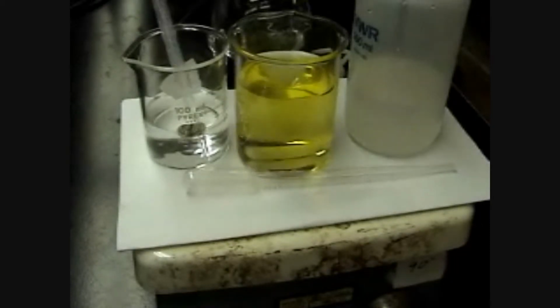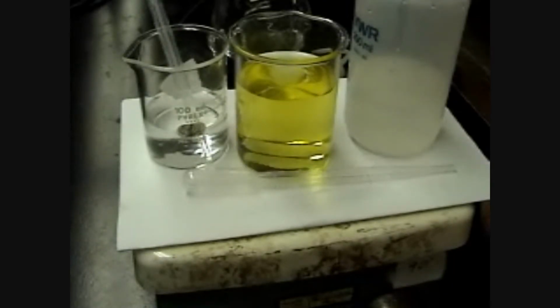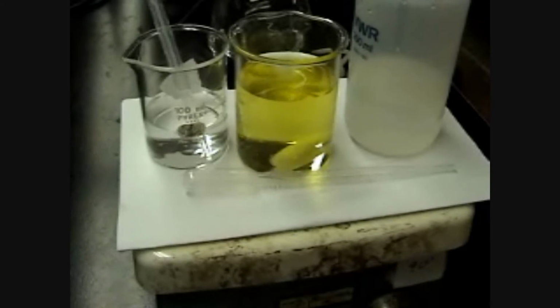And acid and base, simply the concentration of hydroxide ions that are in the chemical, or the concentration of hydrogen ions. But really the way that it looks is that you'll have excess hydrogen ions in the solution or excess hydroxide ions. Hydroxide ion is OH, hydrogen ion is just H+. So again, let's put a drop of this sodium hydroxide and see what happens.